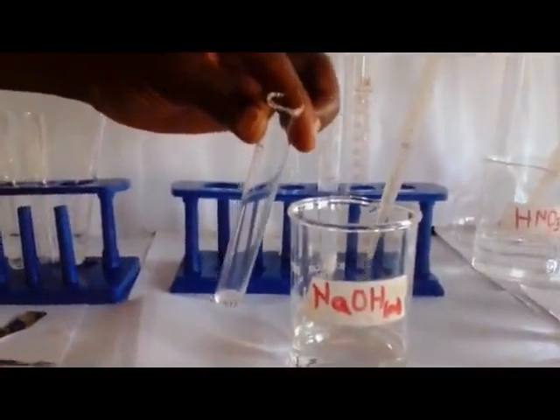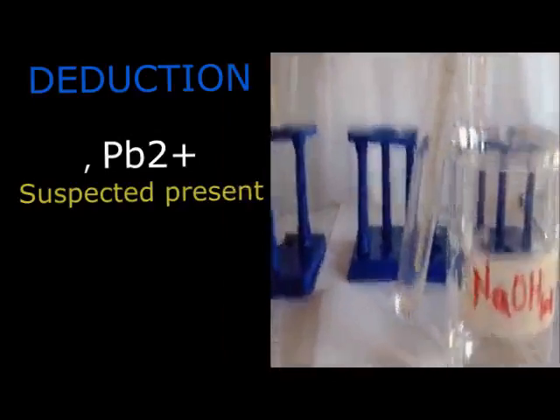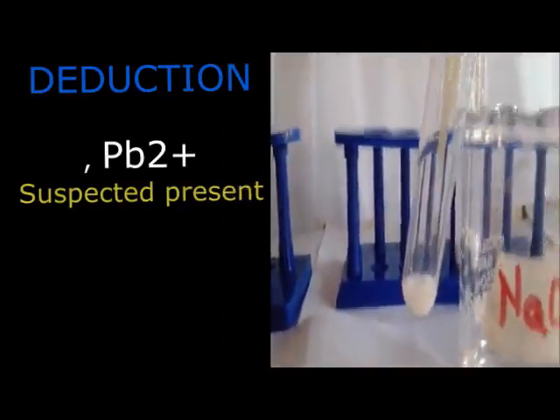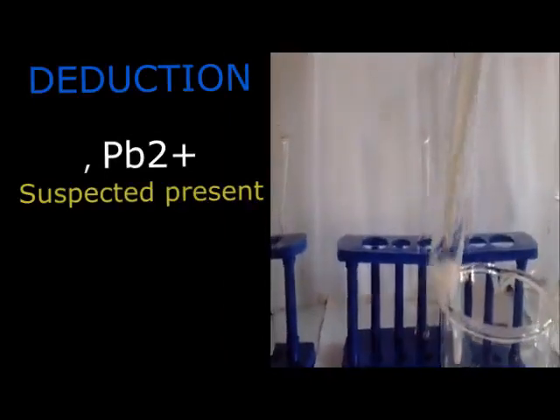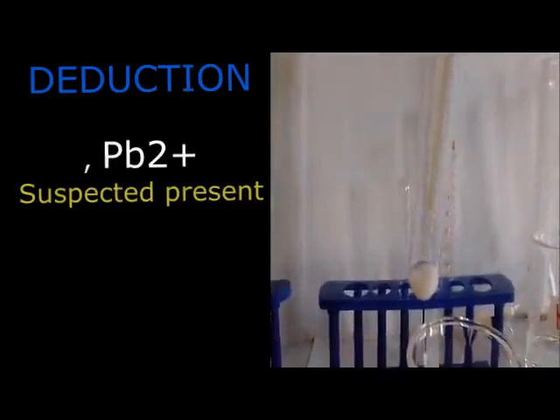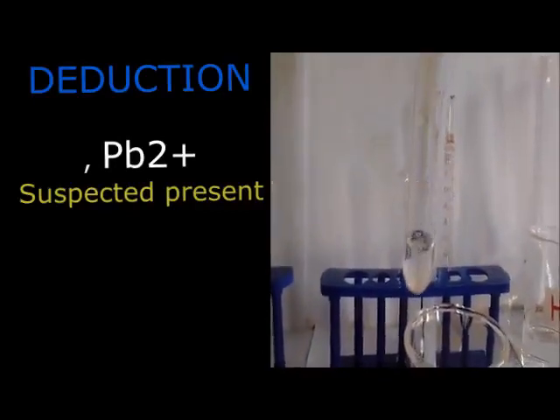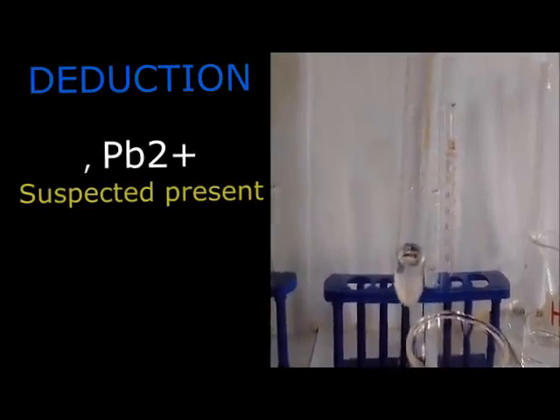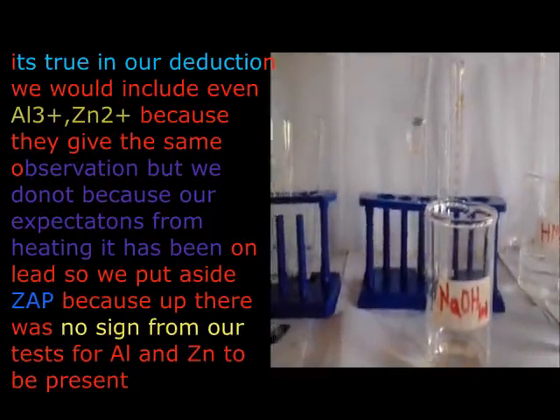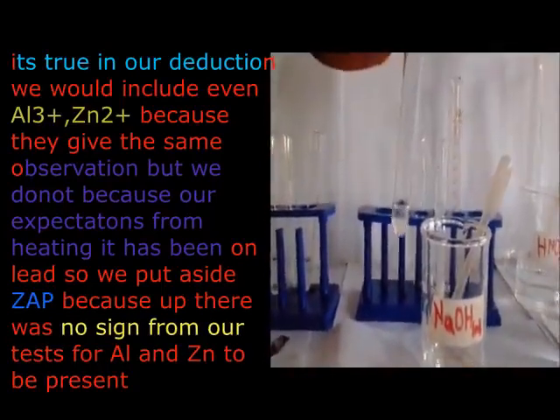Now, when we go to our conclusion, our deduction, it can be done by zinc, it can be done by lead, it can be done by aluminium. However, I don't mention the zinc and aluminium. Why am I leaving them? The ZAP issue. The teacher told you ZAP there, but it is dangerous to put zinc and aluminium here. Why are we not putting zinc and aluminium here?